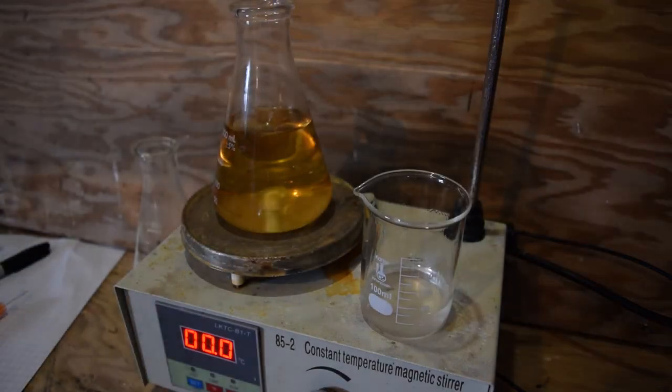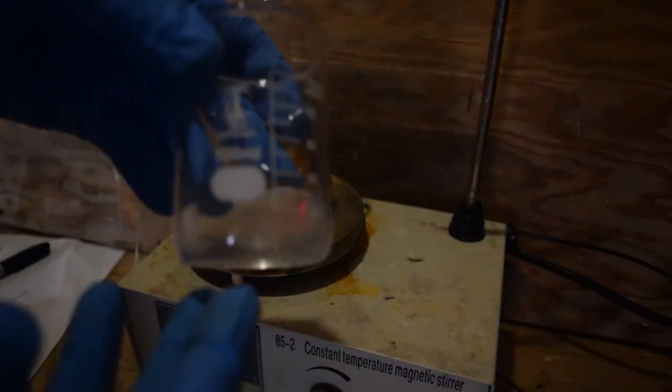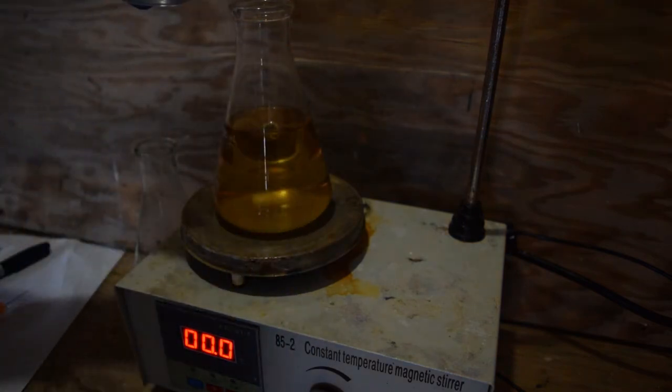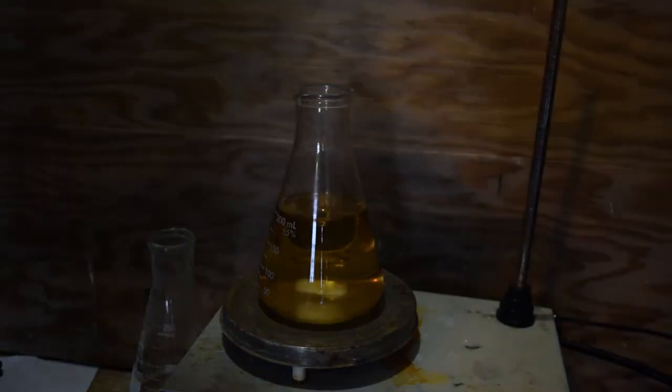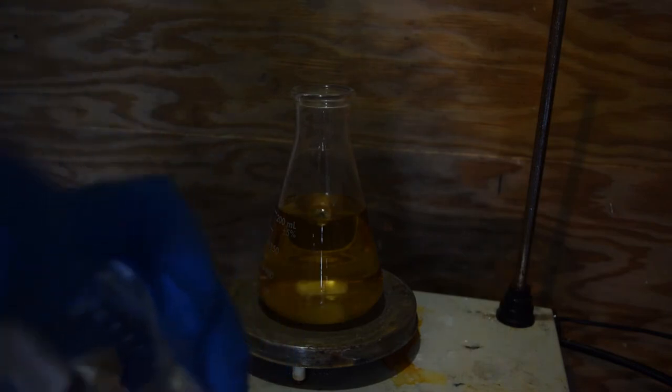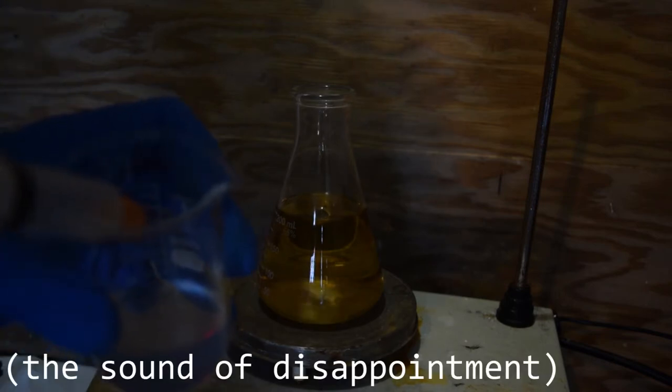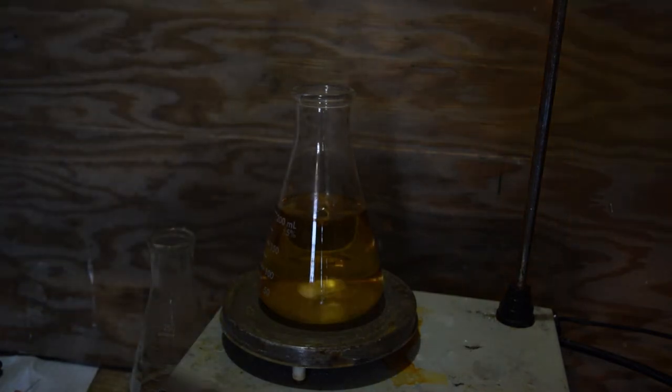Let's say about 75 milliliters of that. That solution of sodium hydroxide and ethanol is pretty strong, it's not dilute, but it did take a while to get all that sodium hydroxide to dissolve in ethanol. So we're going to add this and then work quickly to cover it up and start heating it. Now in a few portions I'm going to add the sodium hydroxide and ethanol mixture using a syringe. Well, that seems just my luck, my syringe doesn't want to work. All right, plan B, we're just going to dump it in.